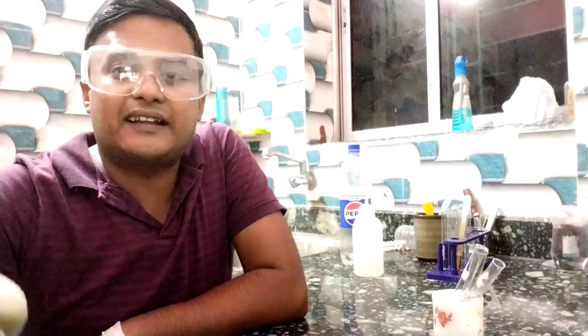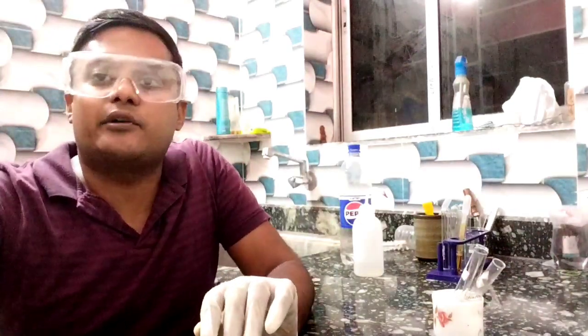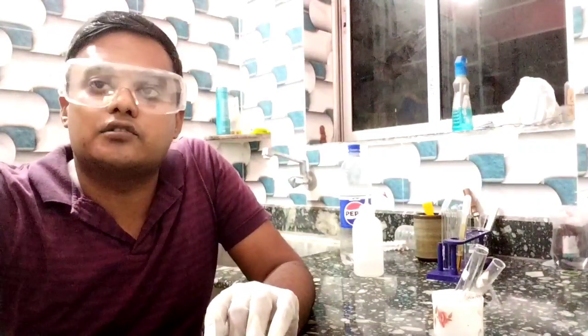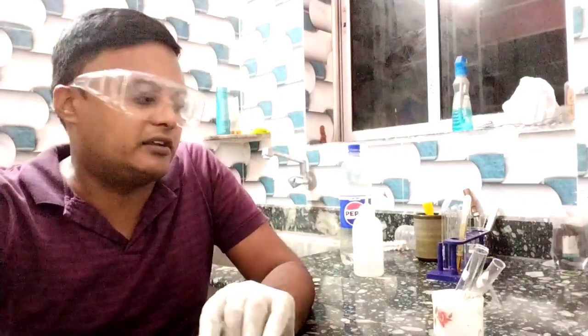Today I'll show you the solubility of iodine. Iodine is insoluble in water but soluble in KI solution and in ethanol. It is soluble in ethanol, that is tincture of iodine, which we use as a mild antiseptic. It is ethanol plus iodine. Tincture of iodine is that ethanol plus iodine mixture. The solute is iodine, the solvent is ethanol, and iodine also dissolves in KI. Iodine is insoluble in water, but it dissolves in potassium iodide, KI.